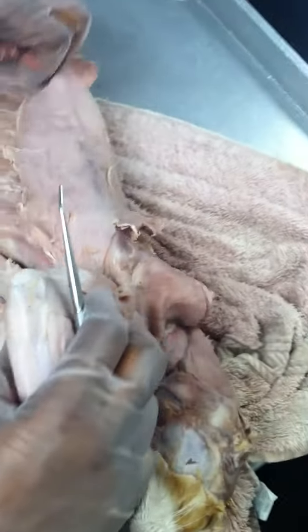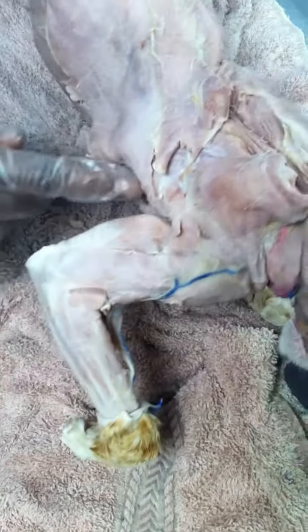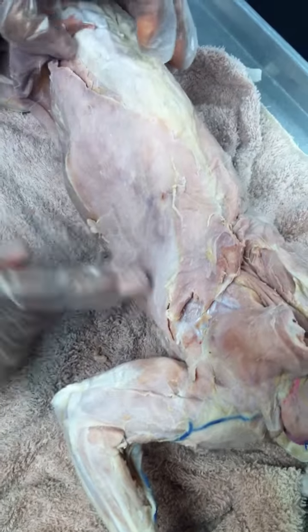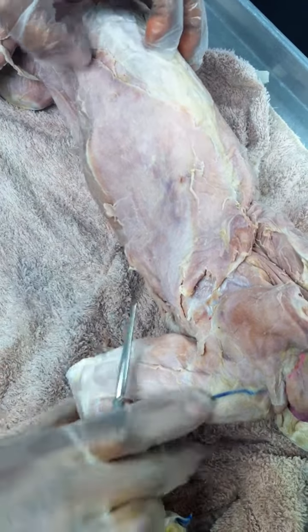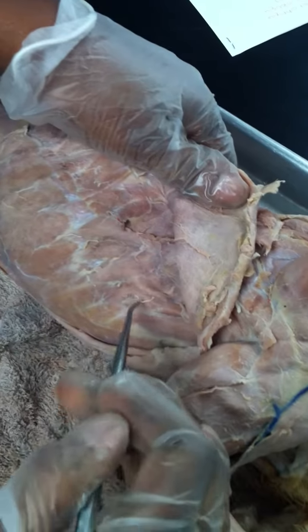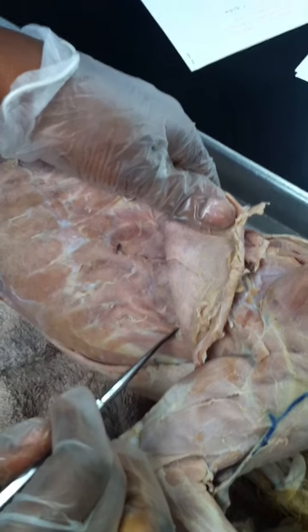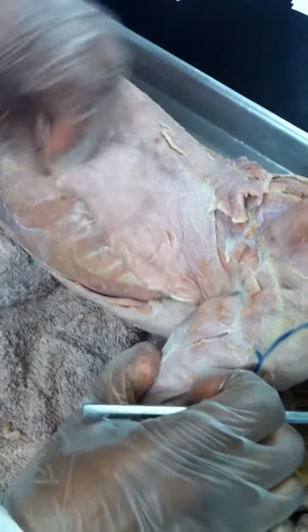Okay. So to the side, the muscle starts under the arm, goes towards the back. This big muscle here, that's your latissimus dorsi. Underneath it, you have the muscle that forms this banding pattern. That's your serratus anterior or serratus ventralis. Okay, going around.